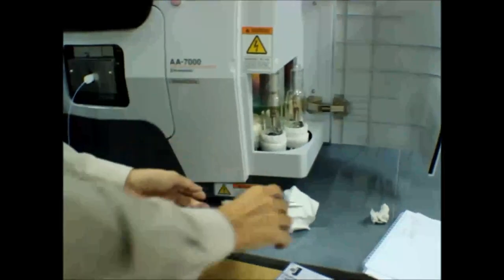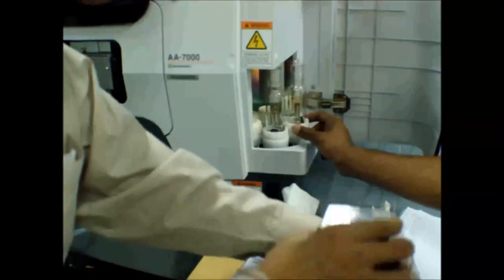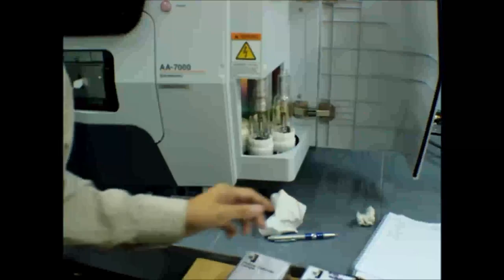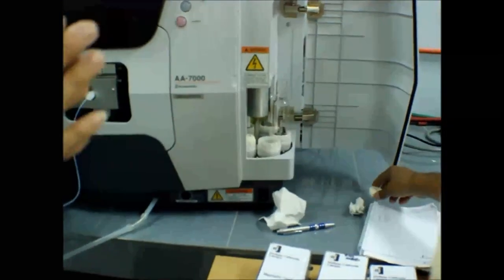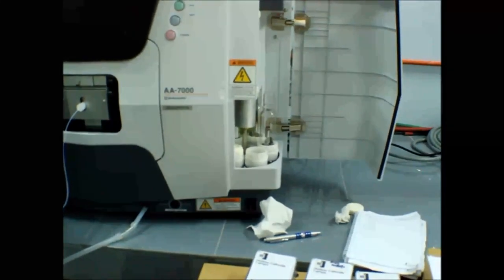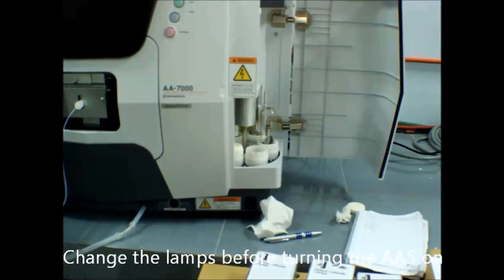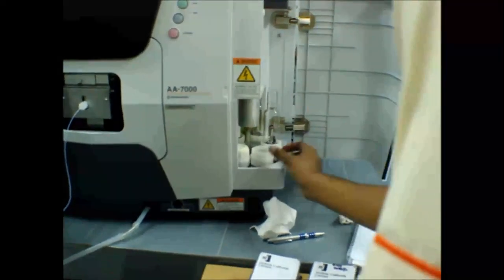Okay, you want to try? So you put copper, ada sudah. Okay, you put nickel and magnesium. Magnesium you put to number 4. Then nickel you put to number 5. Okay, so please remember that. Please change your lamp before you switch on the instrument. Tugas sebelum you switch on instrument.